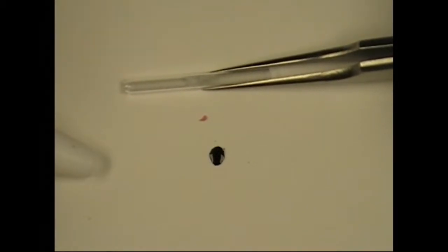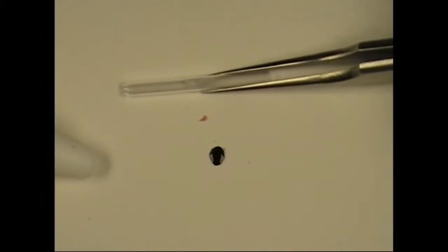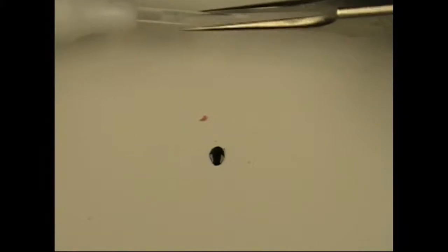We want to put it inside the quartz tube. I've taken a quartz tube here, filled it with quartz wool, and I'm going to insert it into the end of a rubber bulb, and then using the suction of the rubber bulb, just suck the sample up into the quartz tube, and then put the quartz tube into the pyroprobe for analysis.